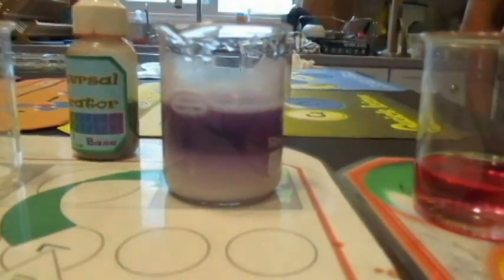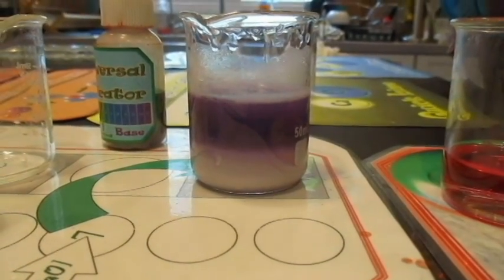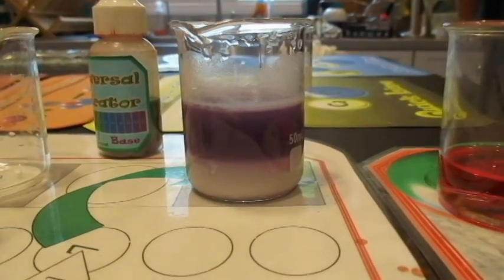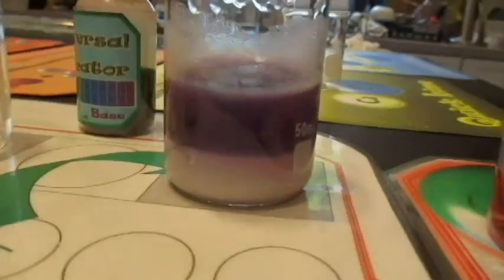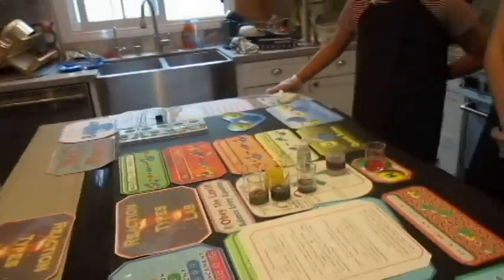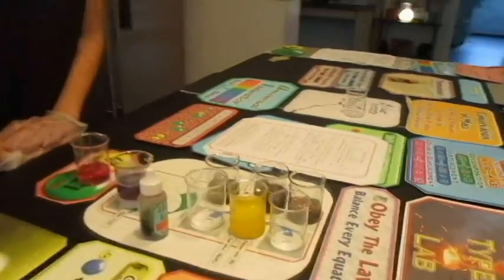Now, do you notice anything else? Anything else happening here? Bottom is kind of white. You can see the powder. So the powder is settling where? On the bottom. On the bottom. So now let's go back and look at that yellow one before we're done. By the way, that was our last reaction for this set of reactions.